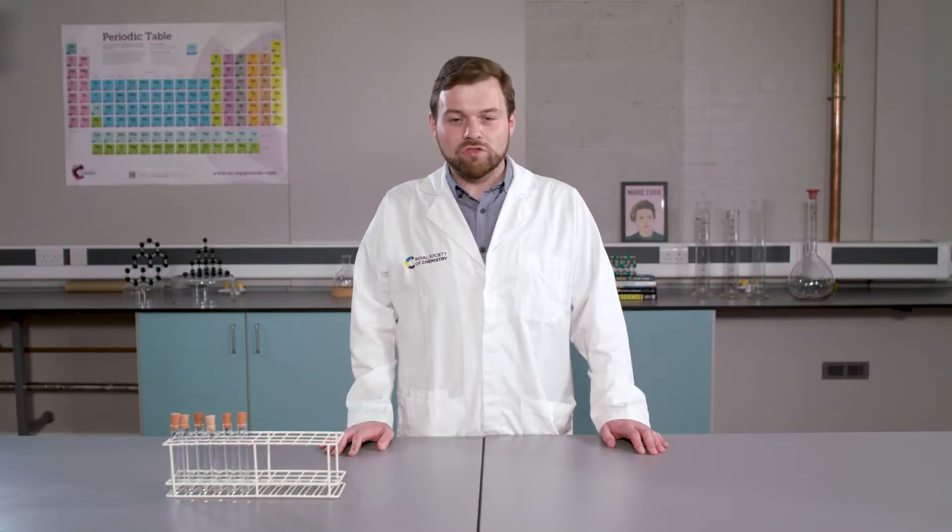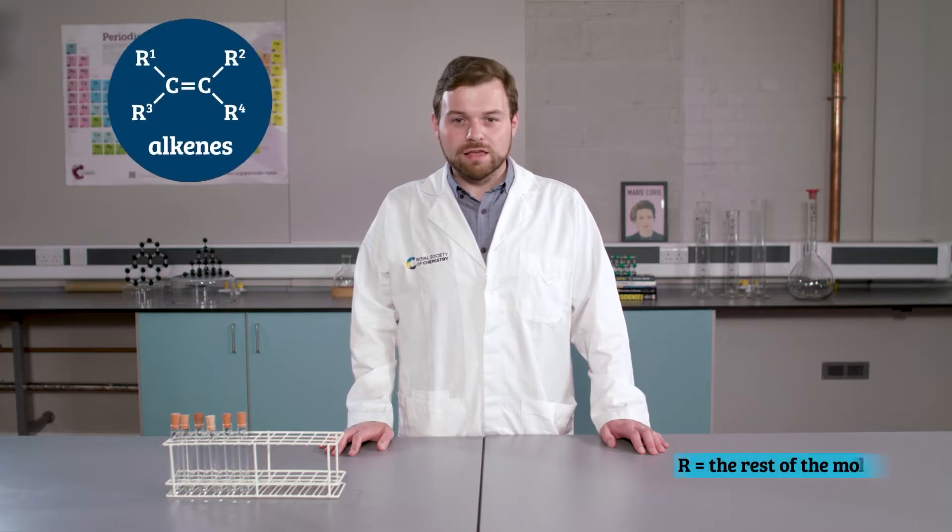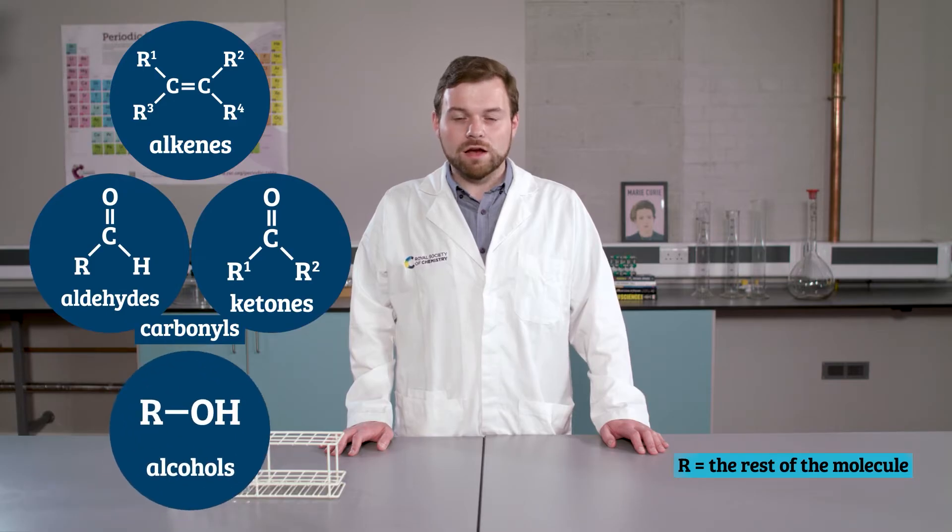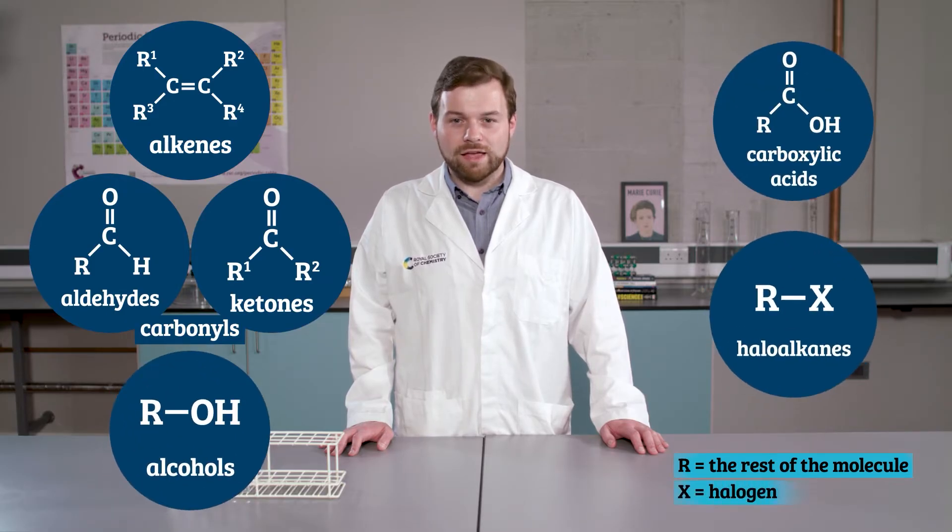In organic chemistry, the most common functional groups are alkenes, carbonyls which include aldehydes and ketones, alcohols, carboxylic acids and haloalkanes.